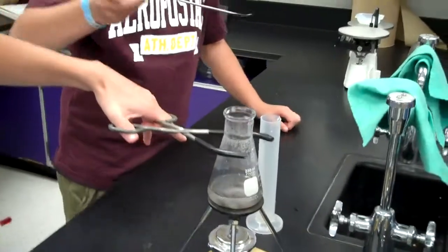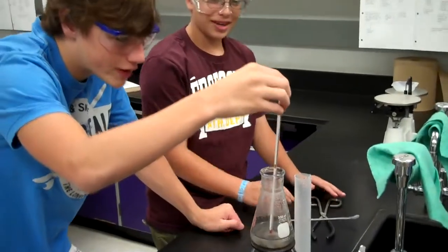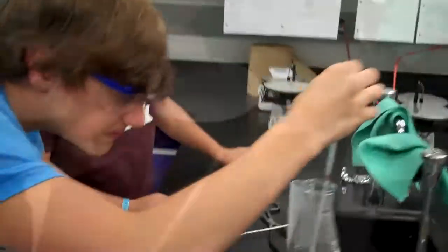Alright, so here we are preparing our alum solution. What temperature are we shooting for, guys? 80 degrees. Perfect. 80.